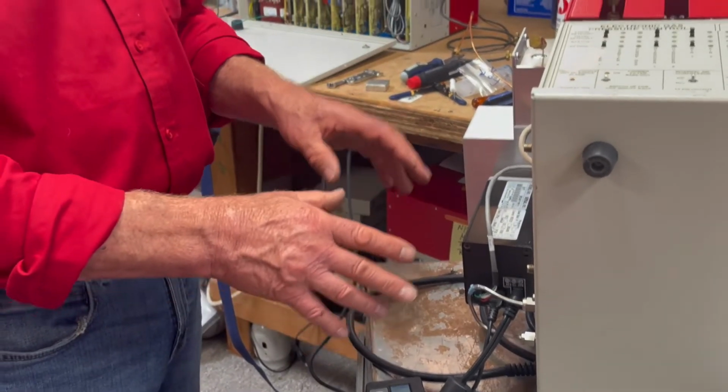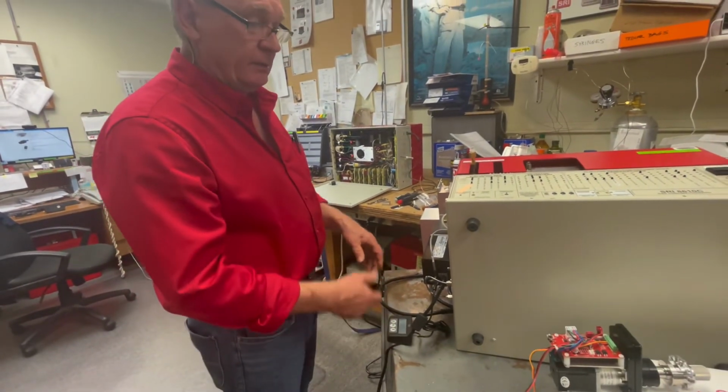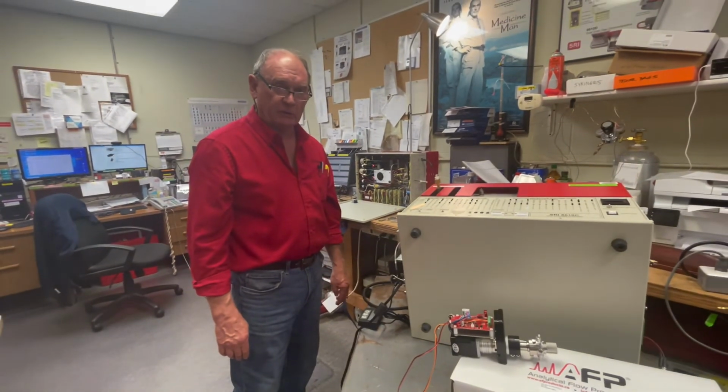If they lose their memory and they don't work, then the first thing to do is reconfigure and then see if it fixes the problem. So thank you very much. That's all on this subject.